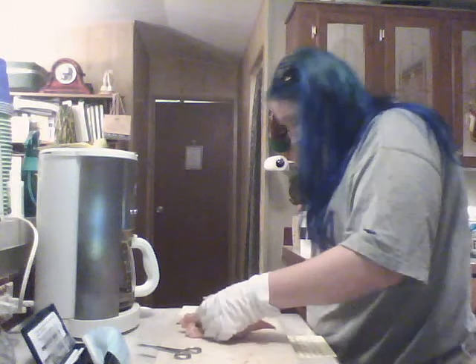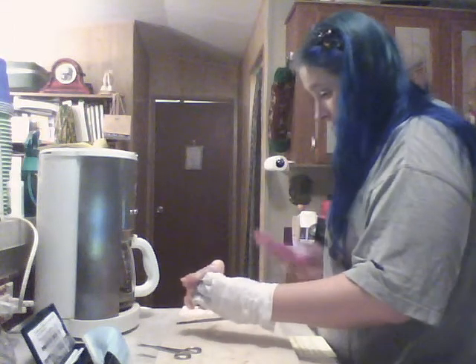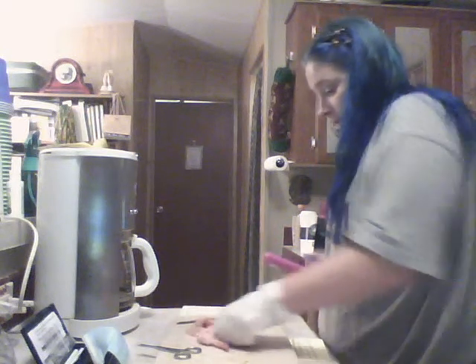Elbow. Well, first, I guess I need to... Okay.